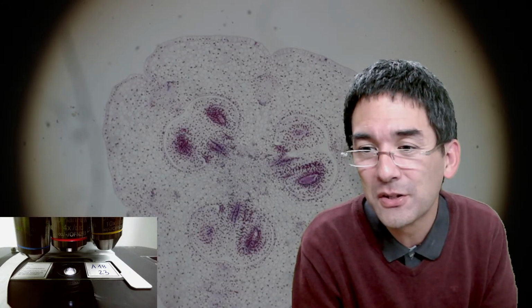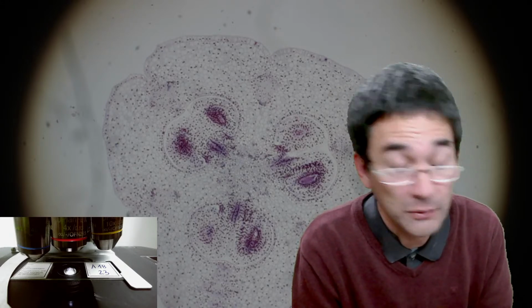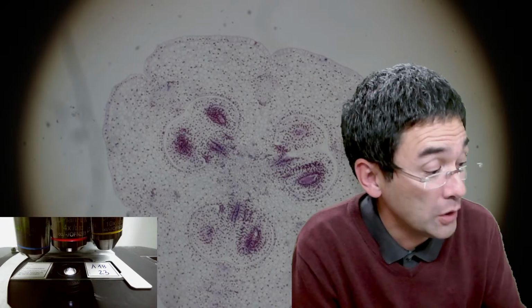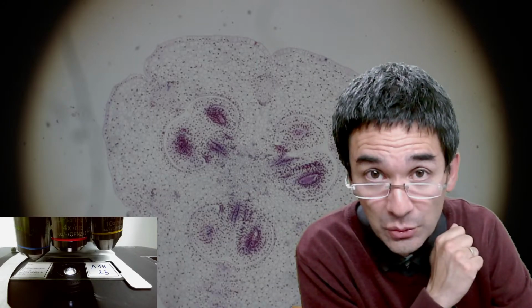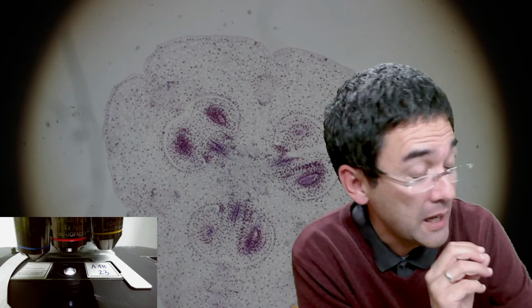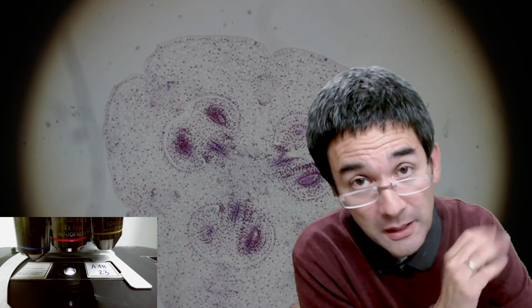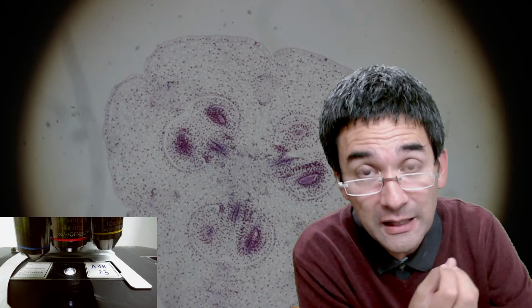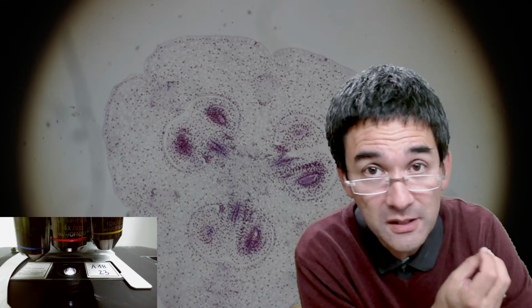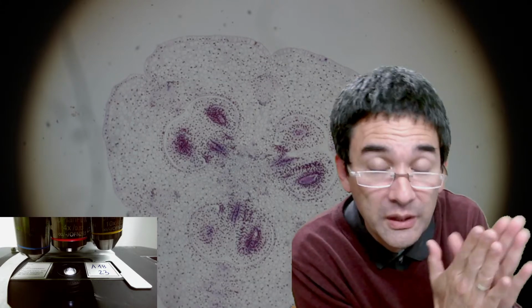Yeah, and the process of the nuclear membrane dissolving and so on, that's something that I have to admit I have not read into yet, but I can imagine this has to do something with the solubility. Maybe, and I'm purely hypothesizing here, in the cytoplasm certain substances are released that cause the phospholipids not to stick together anymore.